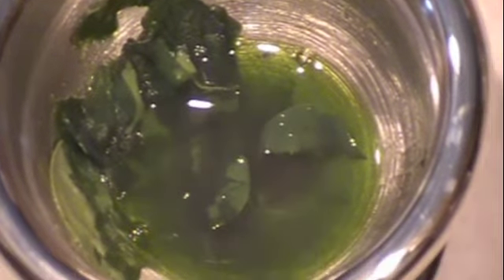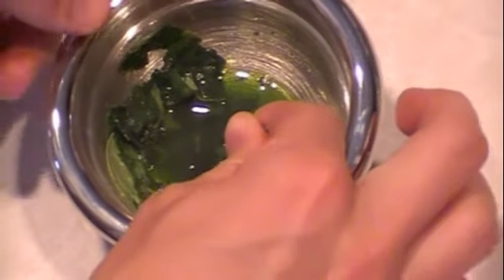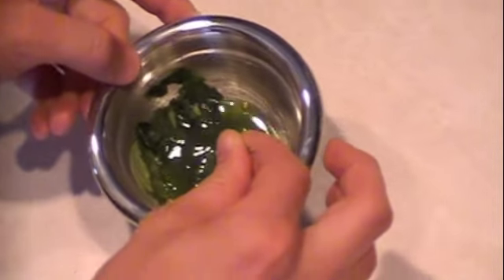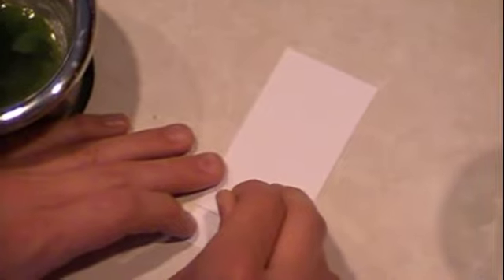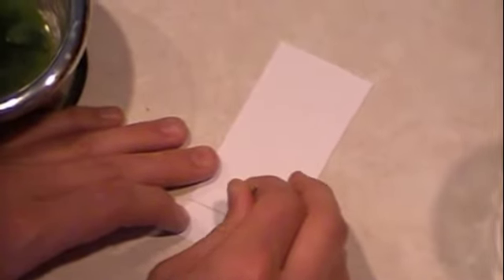Now that we have the plant pigments dissolved in our solvent, we can use this mixture for our chromatography paper. Using a capillary tube, transfer some of your liquid to your chromatography paper. Make sure that you transfer enough of your mixture to the chromatography paper. You want your sample to be dark and concentrated. Make sure to let your samples dry.